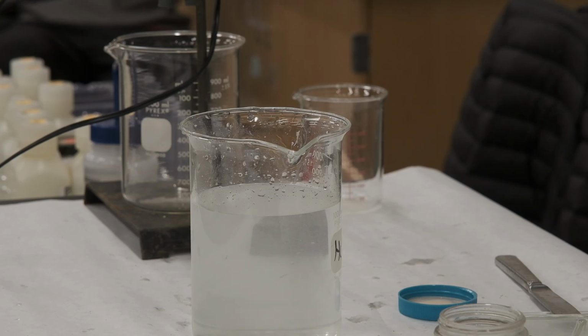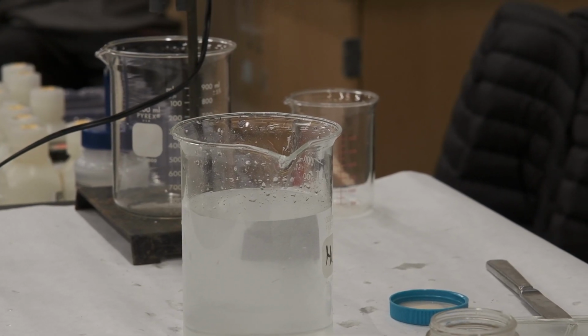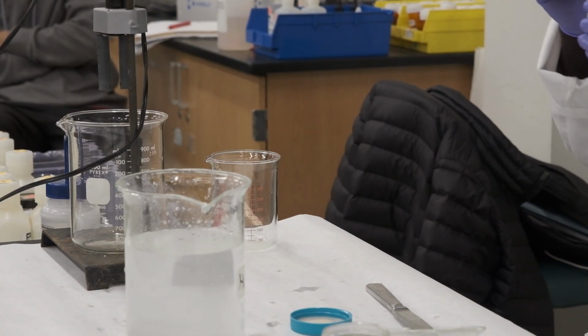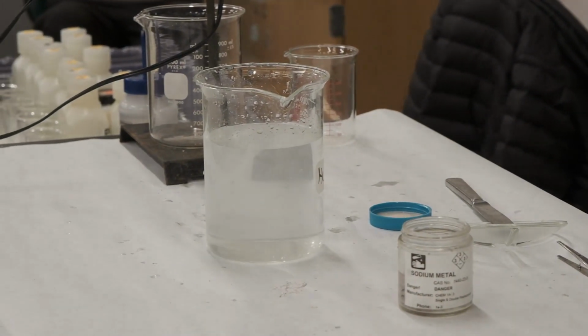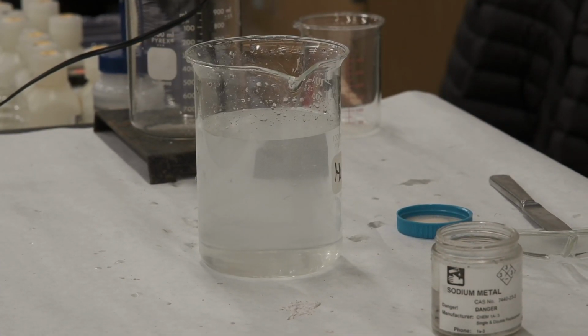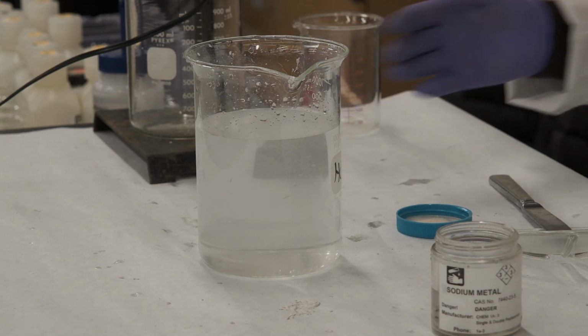So as we will learn when we perform titration, we can indicate if a solution is basic by using phenolphthalein. Phenolphthalein is an indicator, and we'll learn about indicators later on, that tells us if a solution is acidic or basic. If the solution is acidic, the color of the solution stays unchanged. So here it's clear, stays clear.